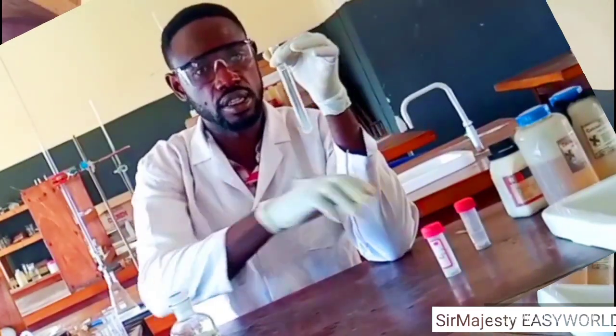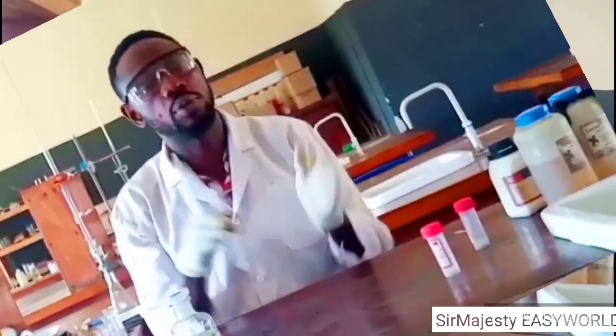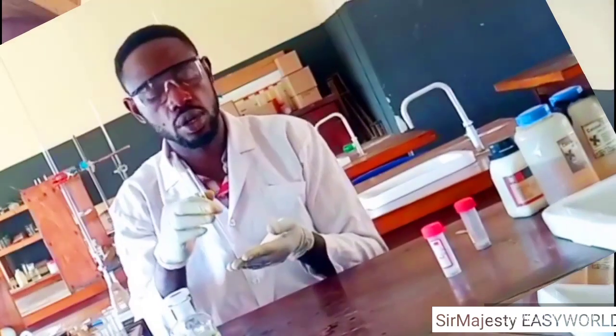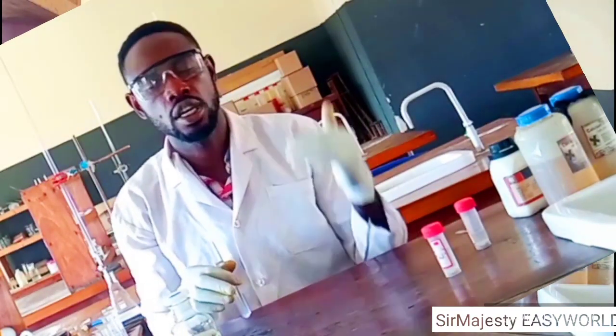So we'll be comparing it now. I'll be running this collectively, analyzing these two samples together. Remember what I've just done: I've given you the test, the observation, and your inference has also been stated clearly.